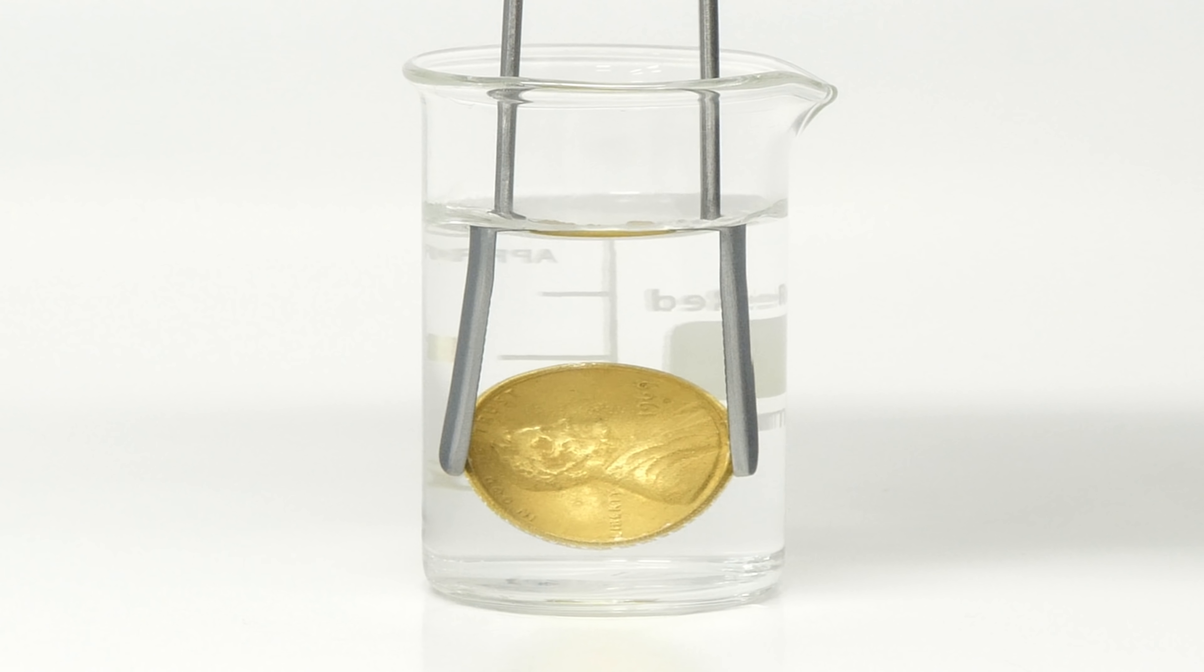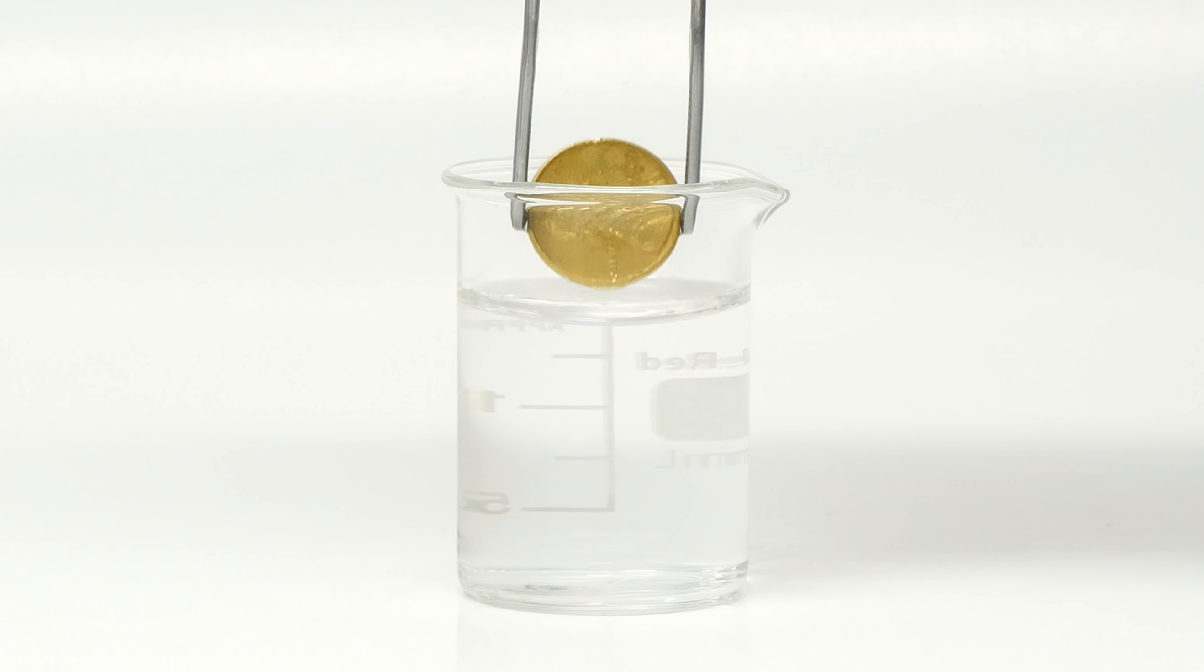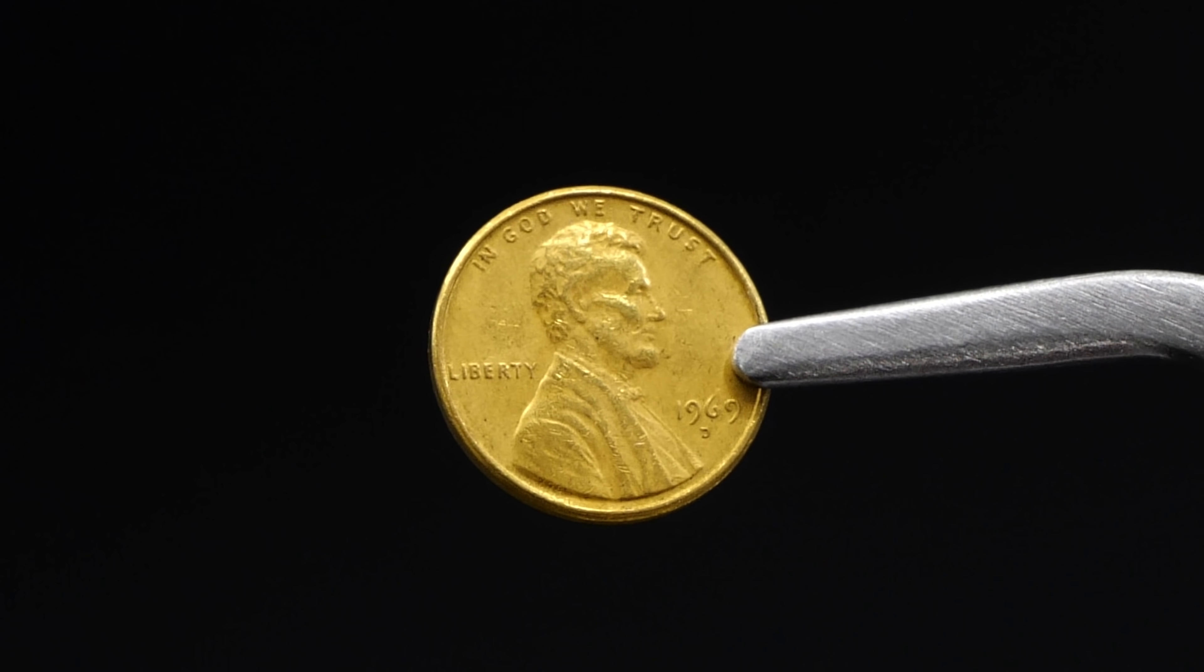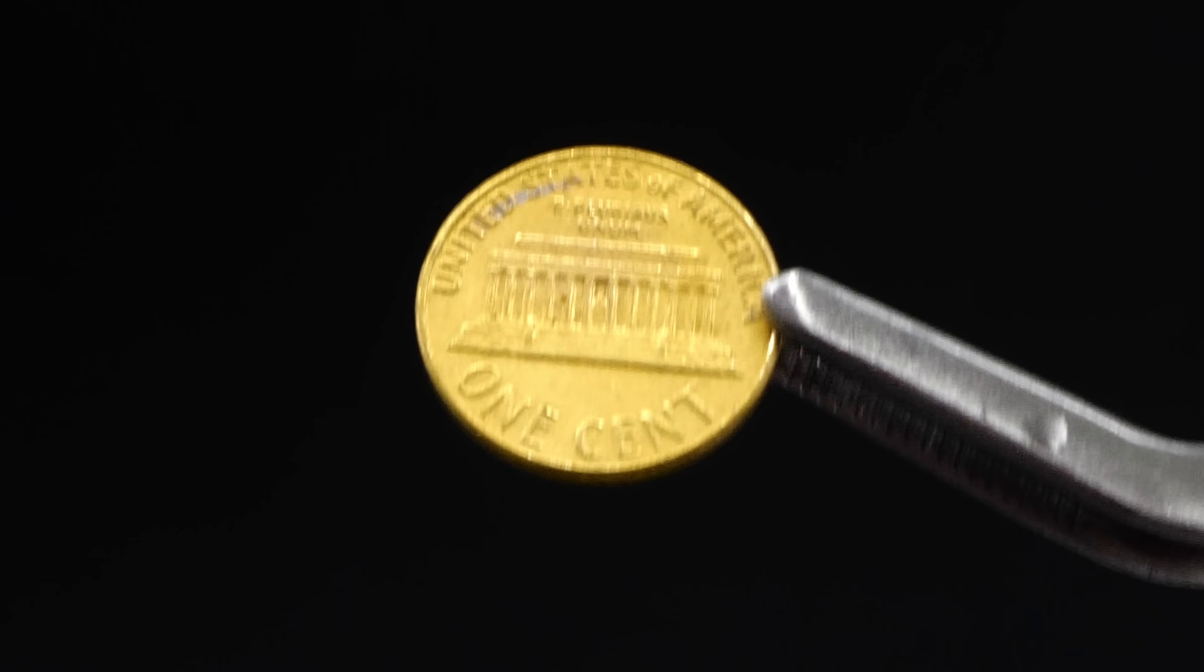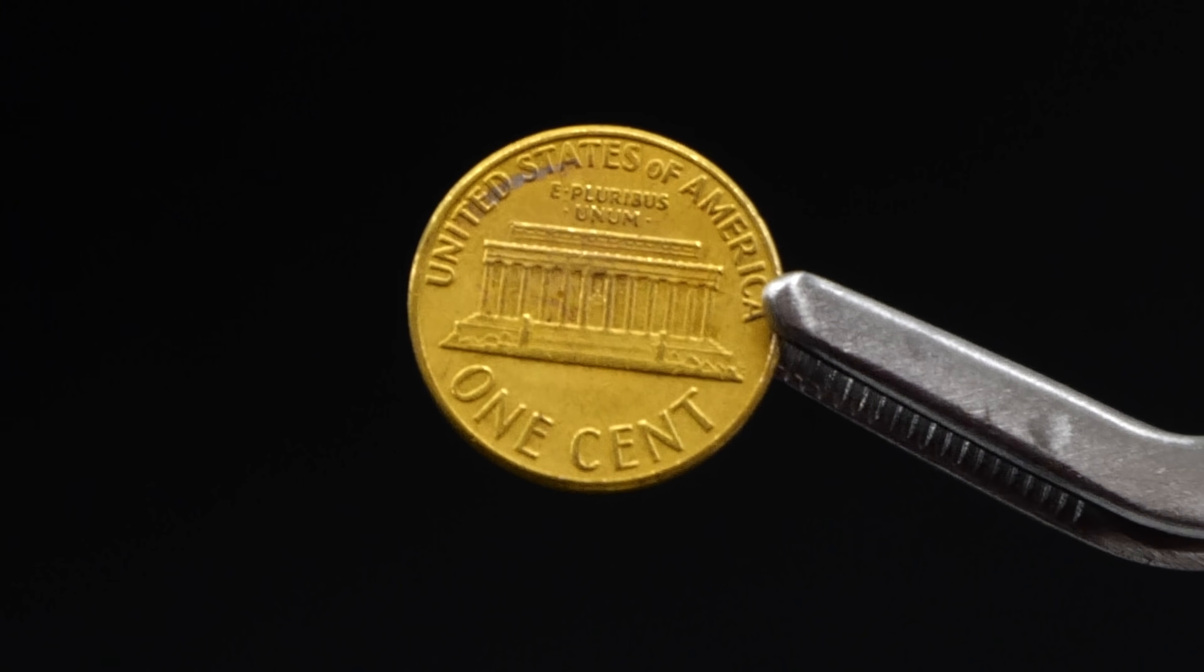Unfortunately though, even if it really looks like it, it isn't real gold. It's actually brass, and it formed because the heat caused the zinc coating to combine with the copper in the penny.